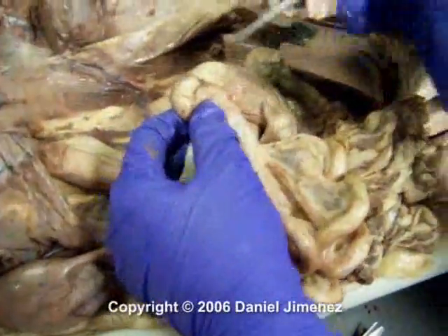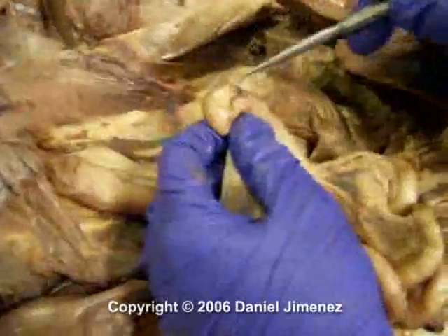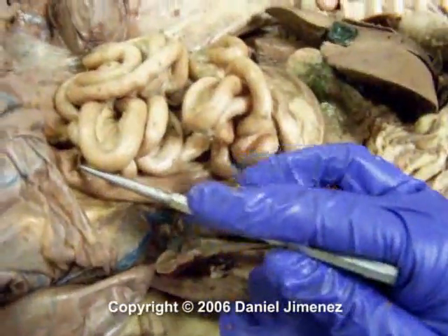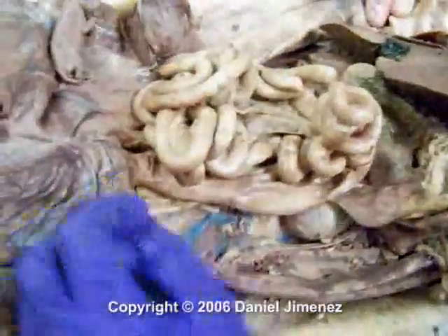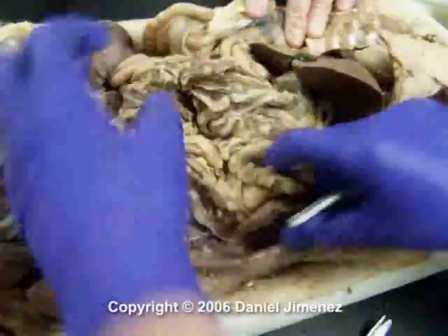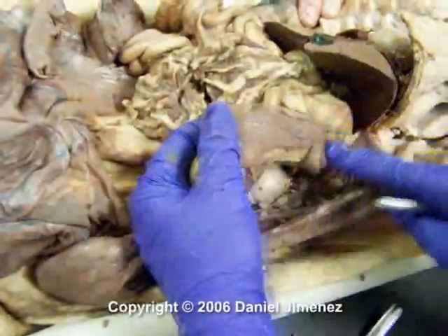Then you have your large intestine. This is the cecum, the blind end pouch. Then you have your ascending colon, your transverse colon, and then your descending colon. And this would be your sigmoid, but I don't see it on there, so you don't have to worry about your sigmoid colon. For your ducts up here, oh, and your spleen. Sorry, here's your spleen next to your stomach here, that's your spleen.